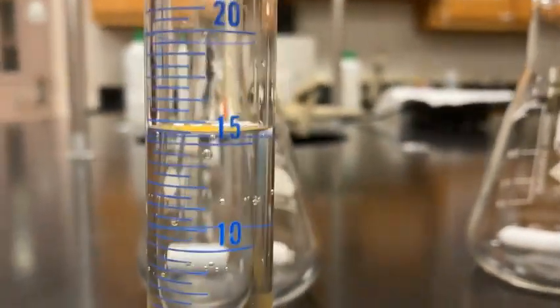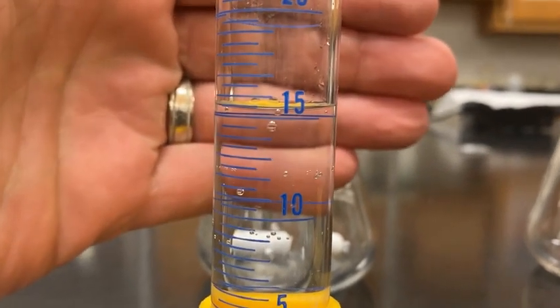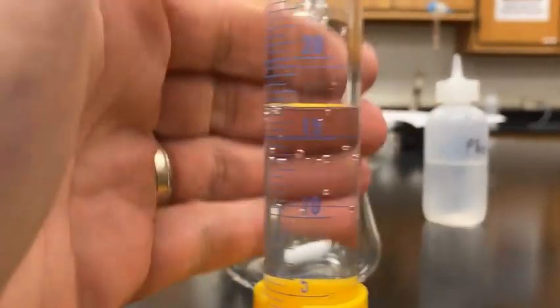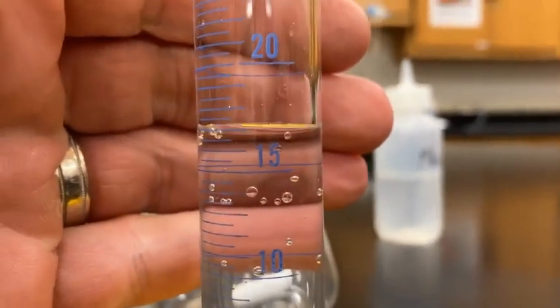measured out. You guys just got to take the measurement. So get down for trial 1. I don't know if that helps a little bit. Let you guys see where the meniscus is. There we go. Watch those increments. And trial 2, going a little bit more.